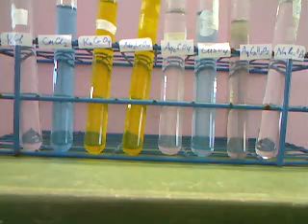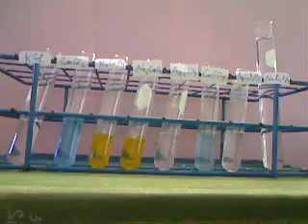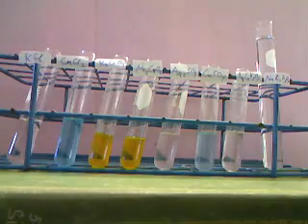This is what our 8 solutions originally look like. The potassium chloride, the copper chloride, the potassium chromate, the sodium chromate, the silver sulfate, the copper sulfate, the silver acetate, and the sodium acetate. We're now going to proceed to mix those solutions together with the other solutions. So we have our 8 solutions. We will now add the sodium acetate to each of the other 7 solutions, stir them together, and see what happens.